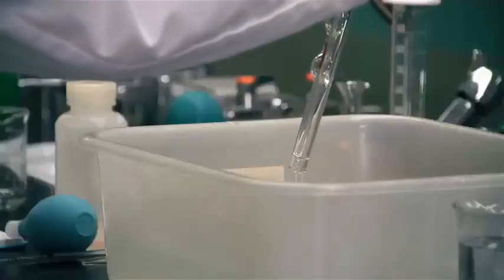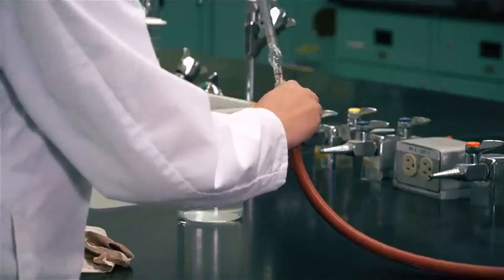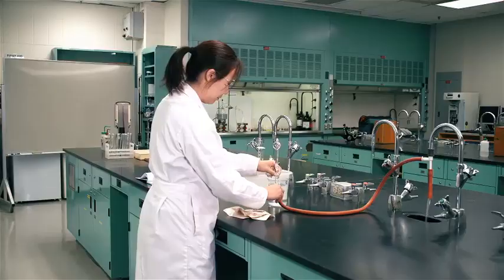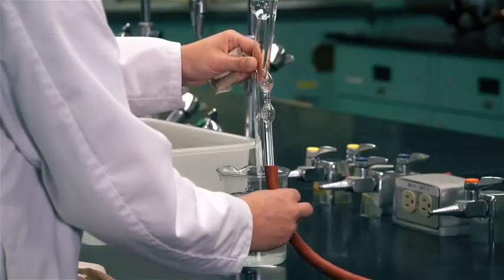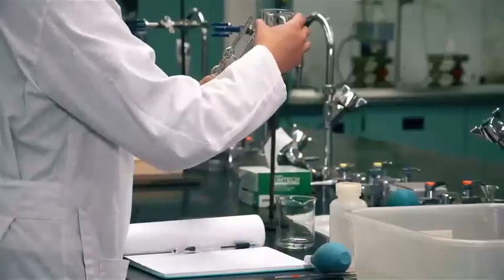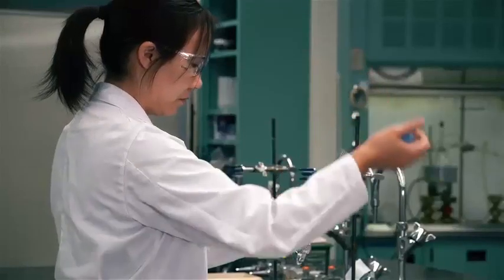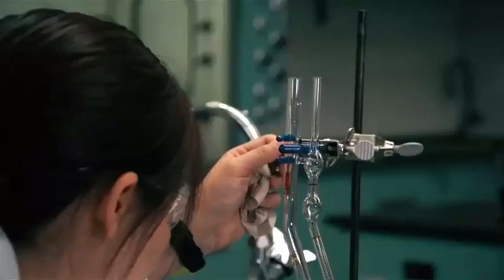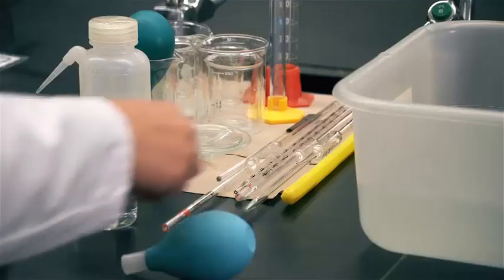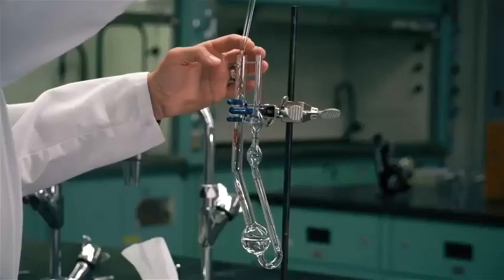Remove the viscometer from the detergent bath and rinse it thoroughly with water using a large beaker and a water aspirator. Rinse the viscometer with the solution whose flow time is to be determined. Carefully clamp the viscometer on the wide leg just above the bridge in a vertical position. Using a volumetric pipette, introduce 10 mL of sample into the large bulb of the viscometer.